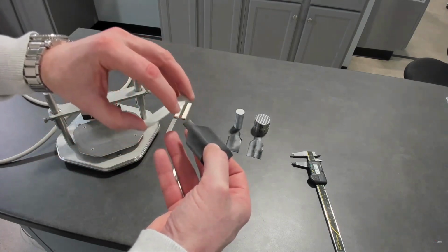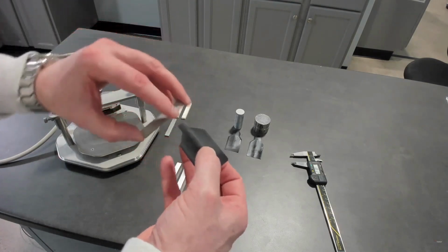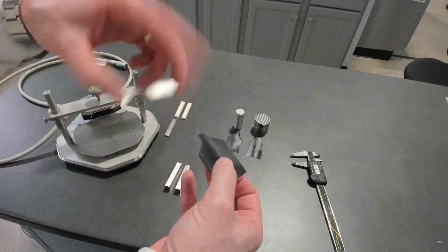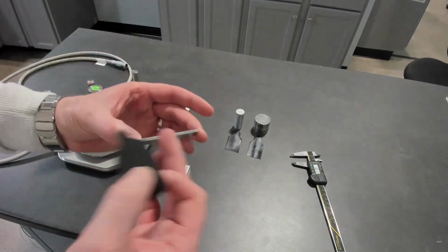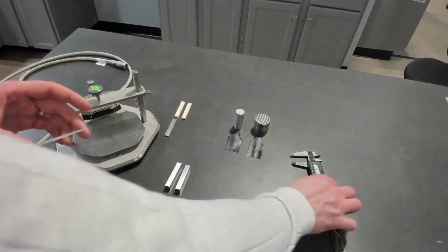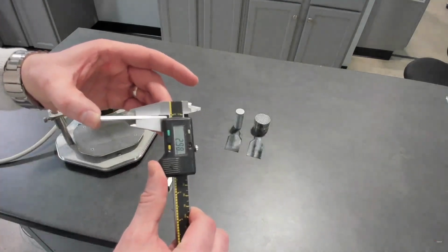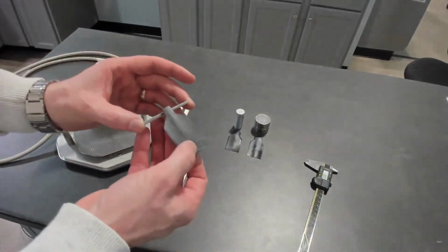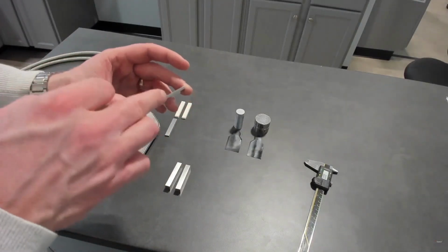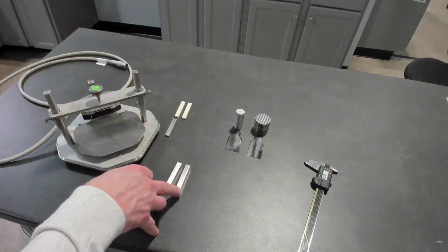As the strip gets bigger, we're hoping that the sample you're selecting is of a similar width to that transient hot strip. In this case, we're just using these examples. But the penetration depth on this sample is only 3 millimeters. Although maybe possible, it's a relatively difficult test, because we want to keep the heat that we introduce within the dimensions of the sample, like the bulk sample.